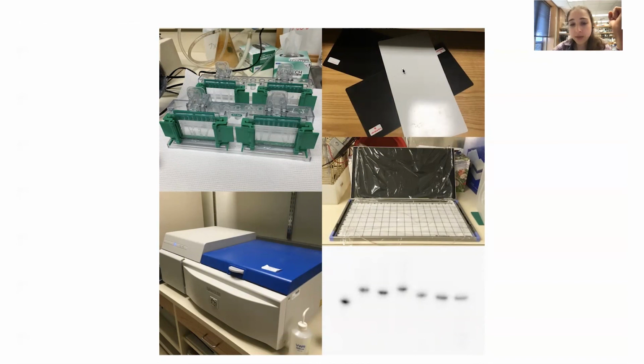In these phosphor screens, these molecules can exist in a kind of metastable state. Before I said how the electrons, when they absorb energy, then they fall down. Well, if you can get them to delay falling down and then direct when they fall down, then you can get a boost on your signal rather than trying to measure each little release event. So I ran an RNA urea page gel with these labeled RNAs. I wanted to see if they were all intact, and they all looked fine, no degradation, that sort of thing.